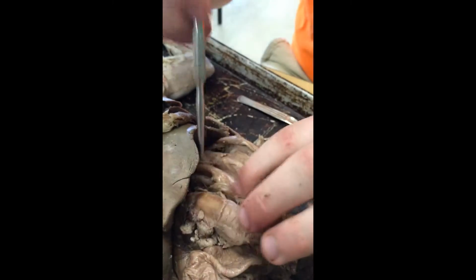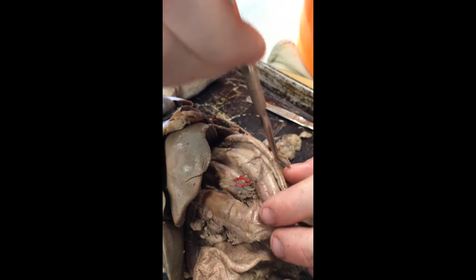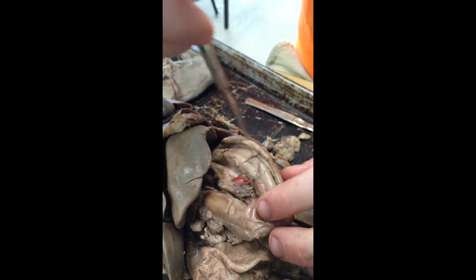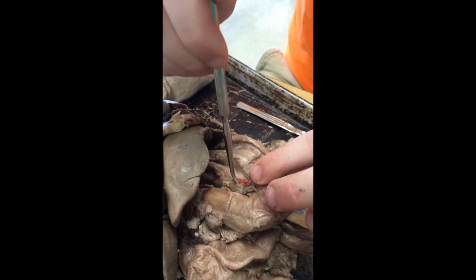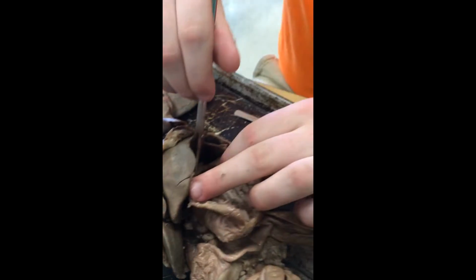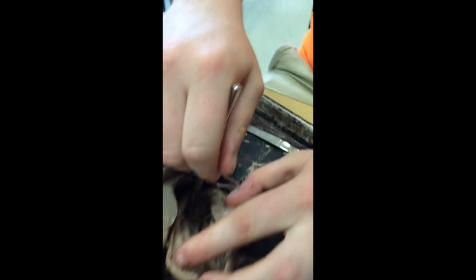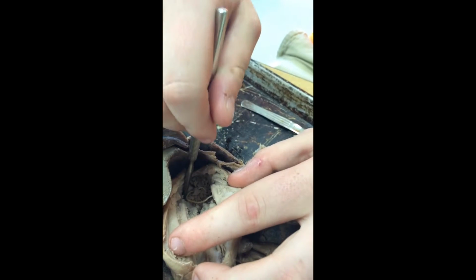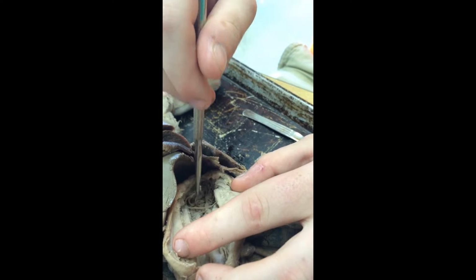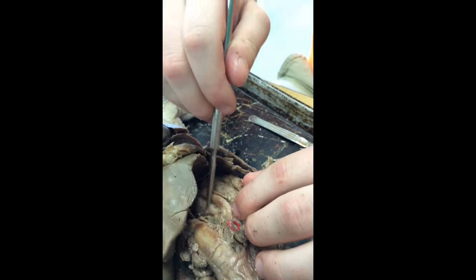Speaking of the stomach, let's move on into it. First, we have the curvatures of the stomach, which is the greater curvature, which is right here on the outside. And then the inside curvature is the lesser curvature. Inside the stomach, the very first part, we have the lower esophageal sphincter. This sphincter gets its name because it is the very last part of the esophagus, and the esophagus enters its contents through the sphincter and into the first part of the stomach, the uppermost region, which is the cardiac region.